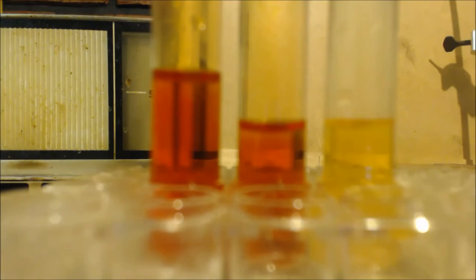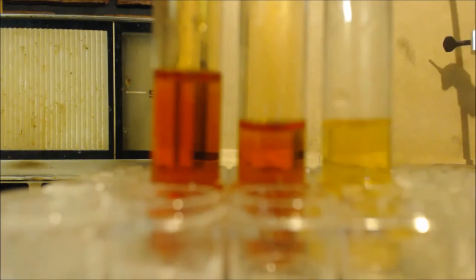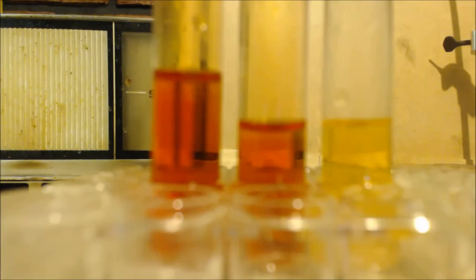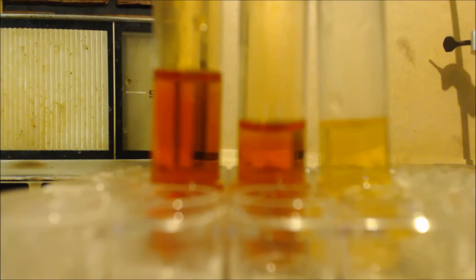But I just wanted to show you the three different colors. Although on camera, these two kind of look like the same color. But this is actually red, this is orange, and this is yellow. And this was my original bromine. I took half of it and put it into here. And when I bubbled stuff through it, it turned orange. But I put too much bromine water in there, you know what I mean? So I took half of it out and I put half in here. And it was orange, and now it turned yellow when we added some more. I kept putting more gas in there. I should have figured out my stoichiometry, but I didn't. But you get the gist.